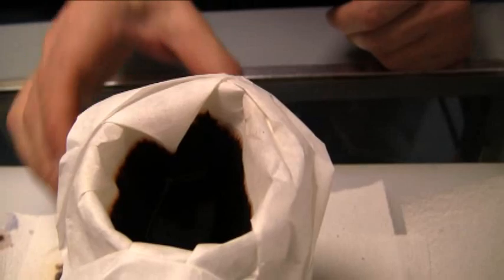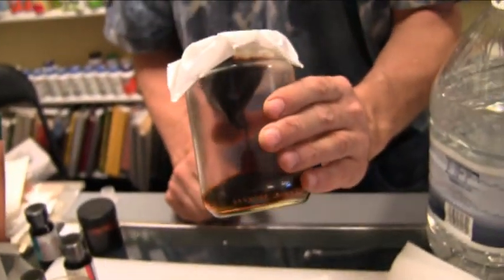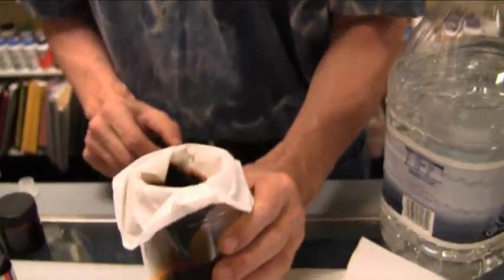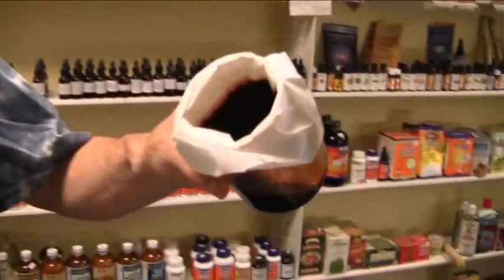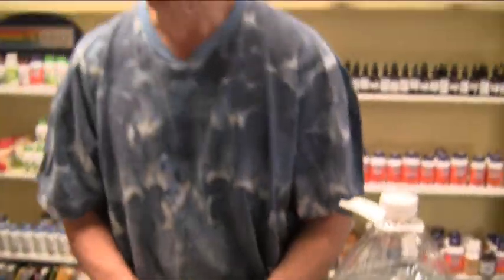Can't really see it if there is any. Still filtering. I'm not sure why. Okay, we will try that again. For whatever reason, that didn't work — unless there is a film there. Yeah, it's not showing because it's too dark. We're going to try that again.